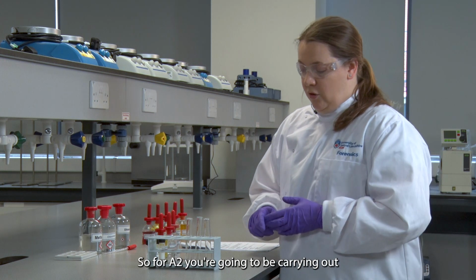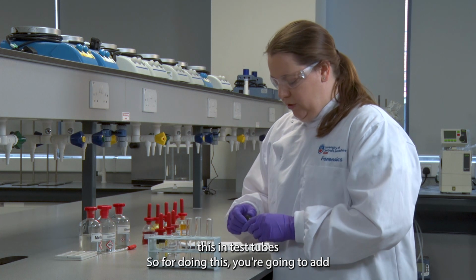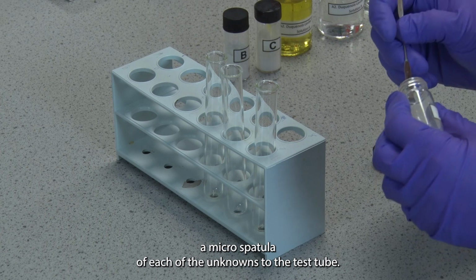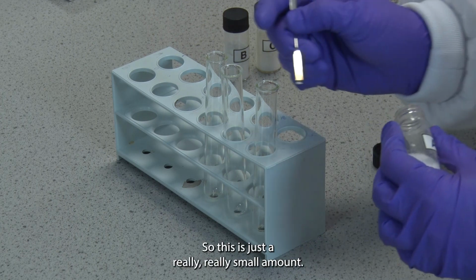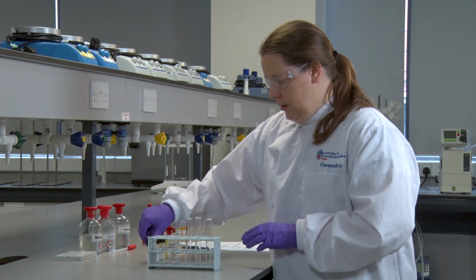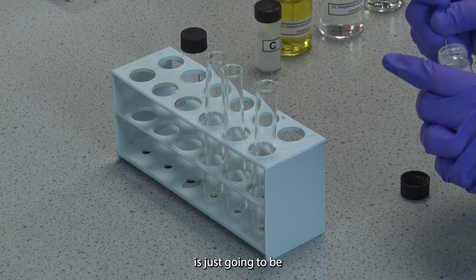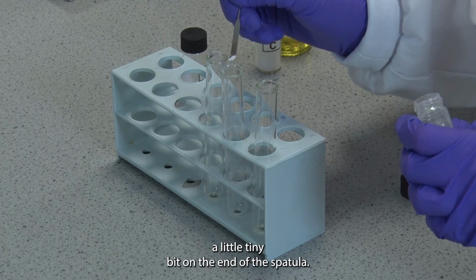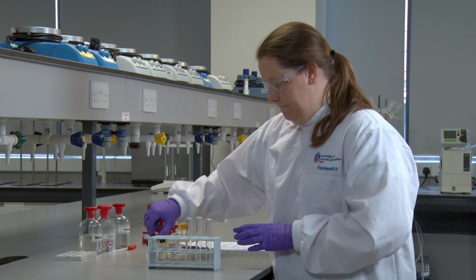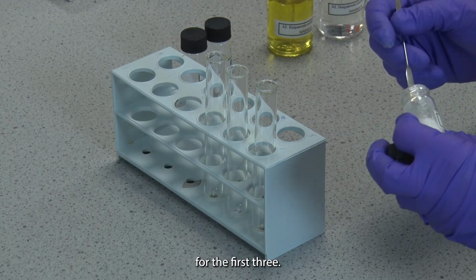So for A2 you're going to be carrying out this in test tubes. For doing this you're going to add a micro spatula of each of the unknowns to the test tube. So this is just a really small amount. So the unknown is just going to be a little tiny bit on the end of the spatula. So I'm showing you how to do this for the first three.